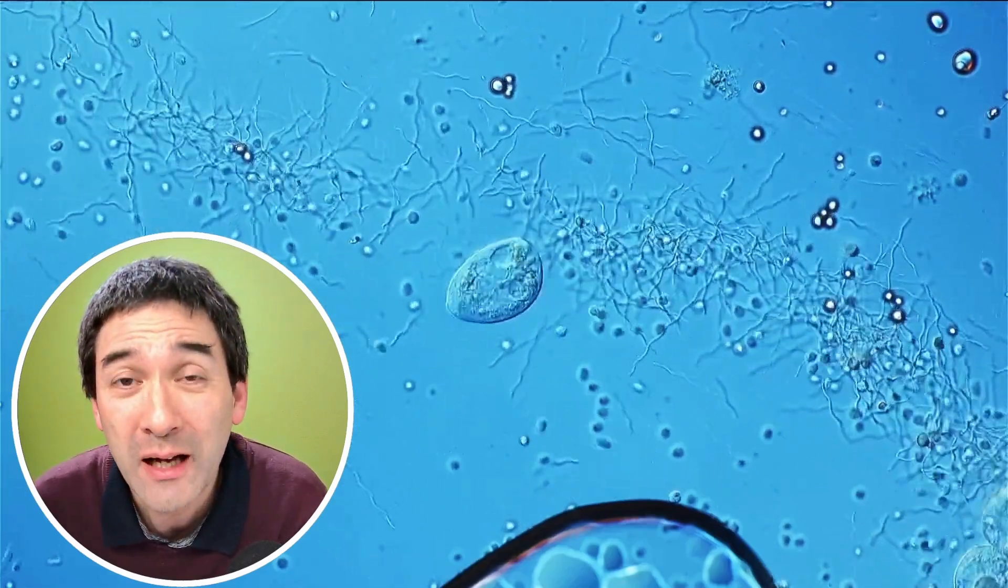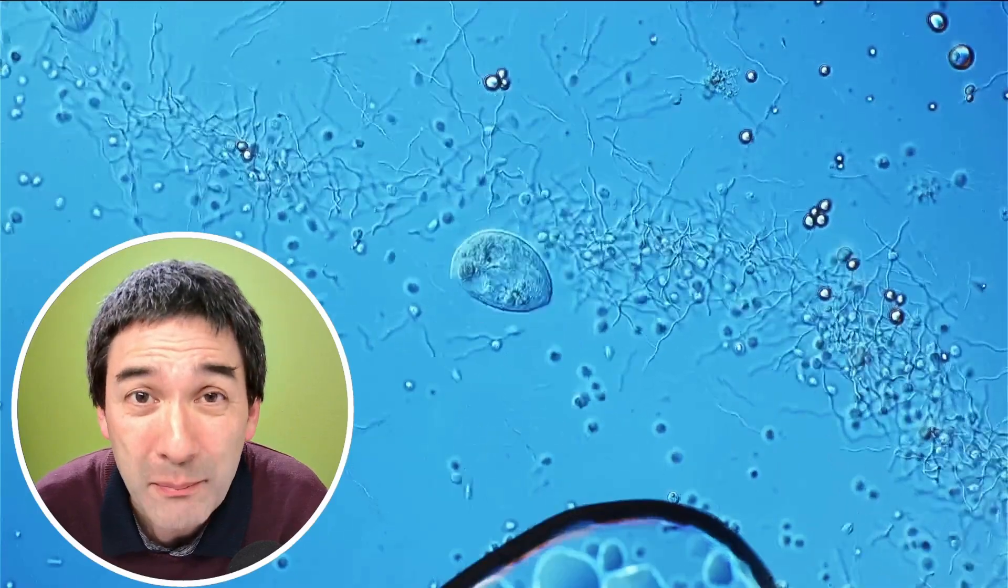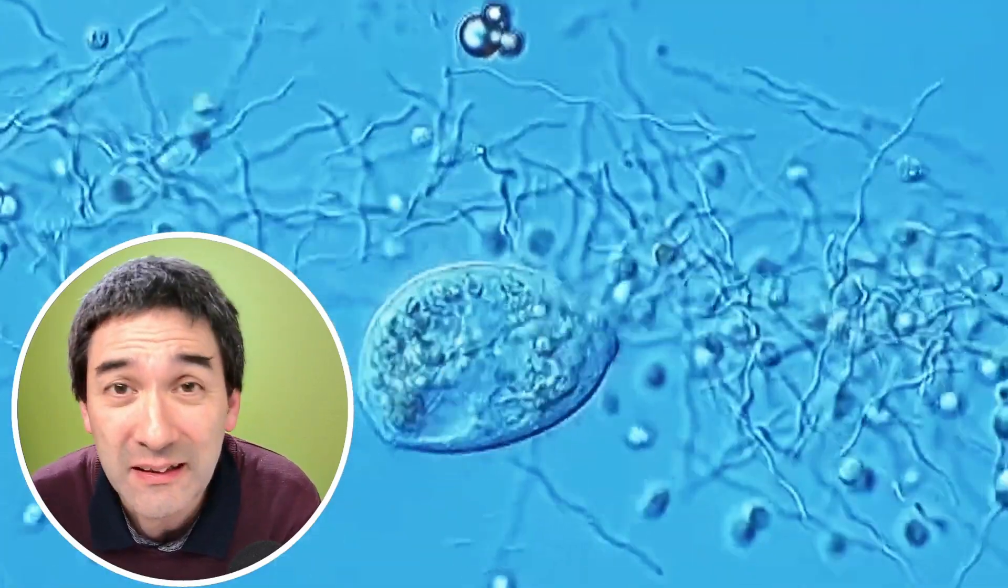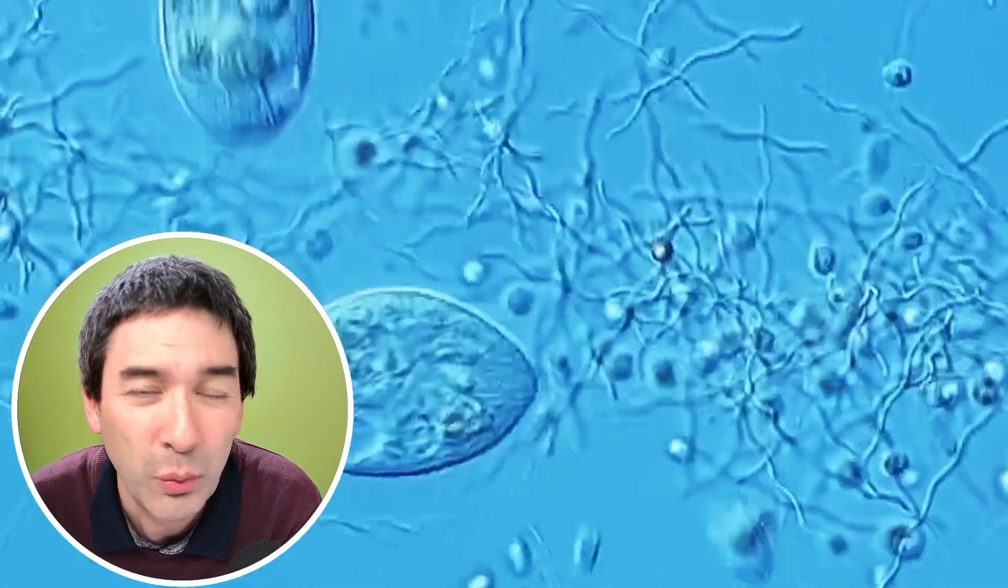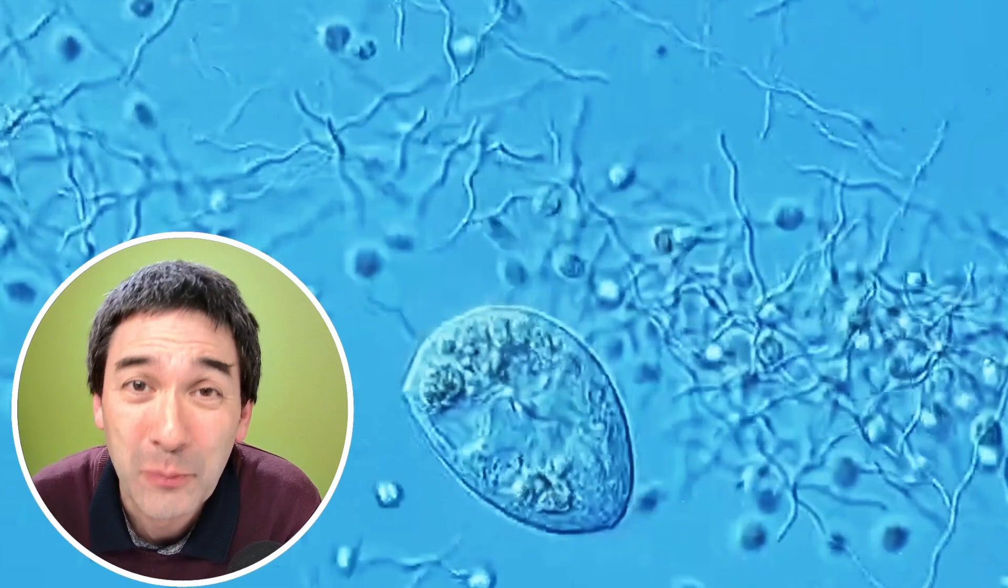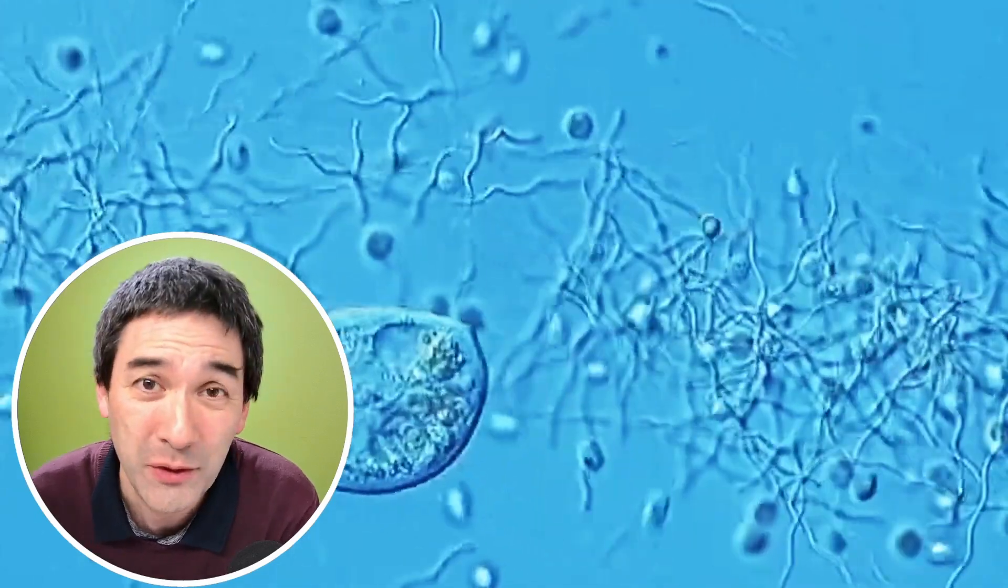And so for this reason, after I put the sample on the microscope, I essentially had to properly disinfect it and clean everything away because I do not want to have those bacteria essentially being spread around on my desk and on my fingers and whatnot.